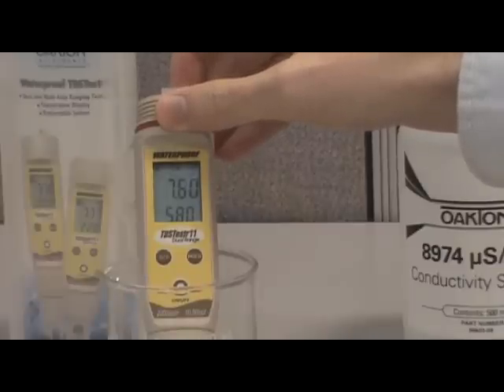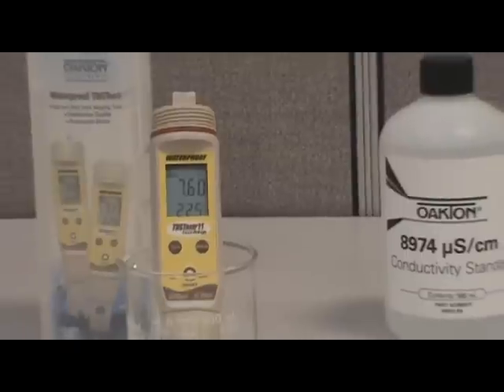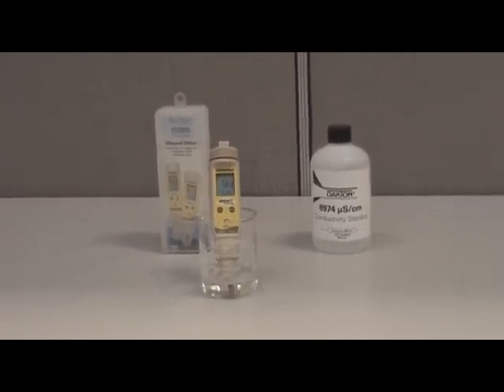Once you've reached the value of your standard, let the tester sit for 5 seconds, and the bottom of the display will show CO to let you know the calibration is confirmed. The tester will then return to measurement mode, and you are now ready to measure your sample.